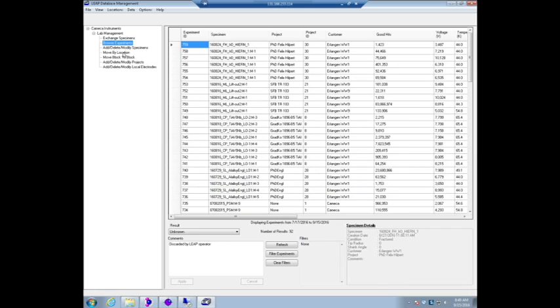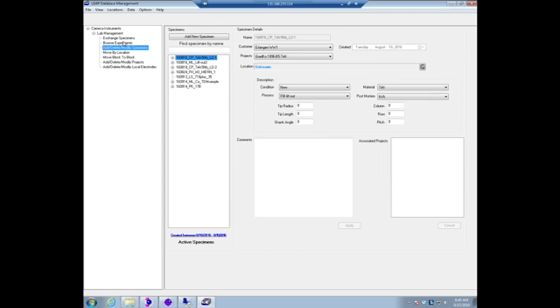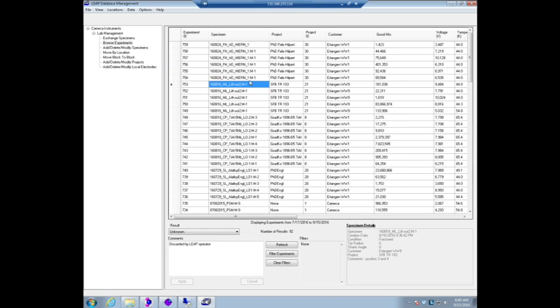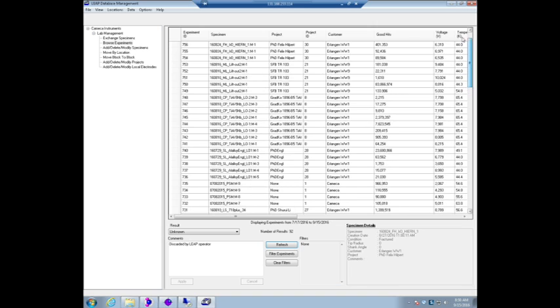And it knows things like different, so you can look where specimens are, you can browse the experiments, and that's obviously going to be very, very important. So you can see every single experiment you can see here. So if you go to and refresh. Then, okay, I probably need to change the period as well for which it shows the experiments.